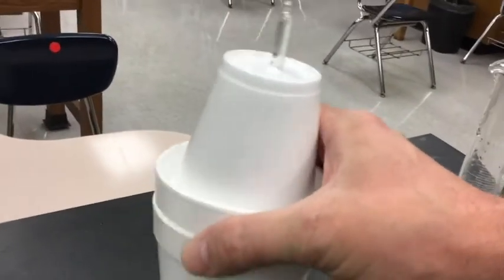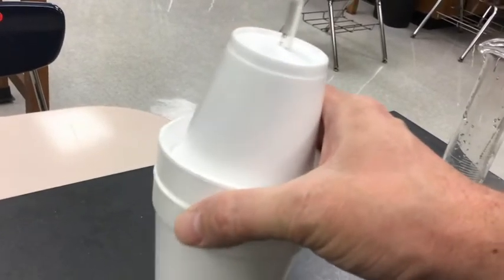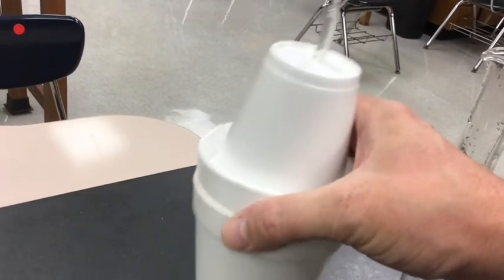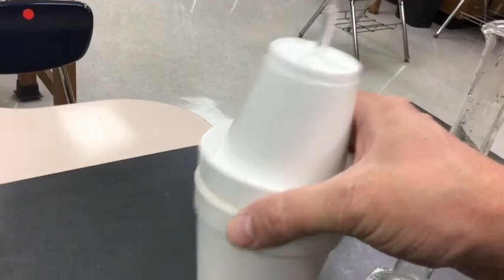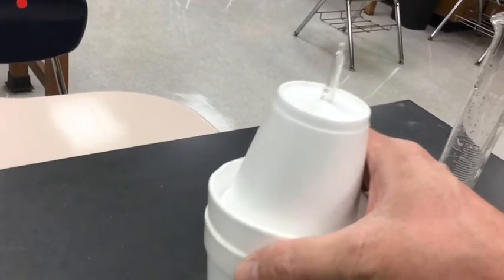So this is the exciting part where we fast forward. I'm going to make sure all of that reaction is good and reacted. I know it's done when the temperature stops going up.